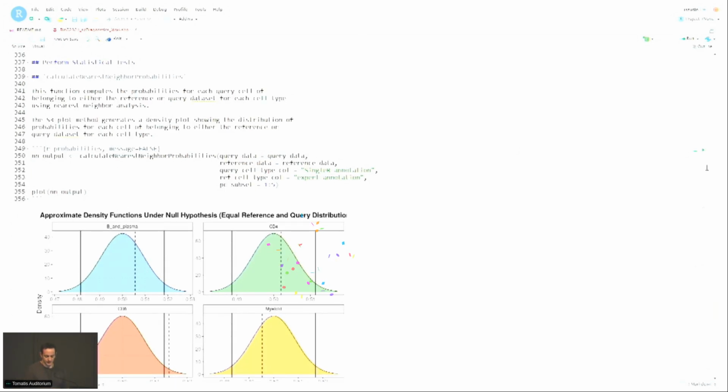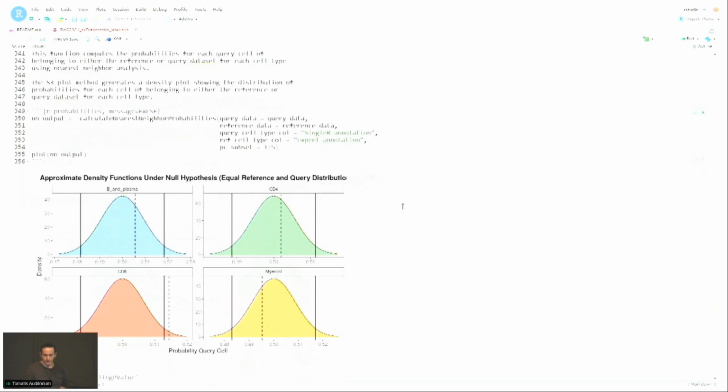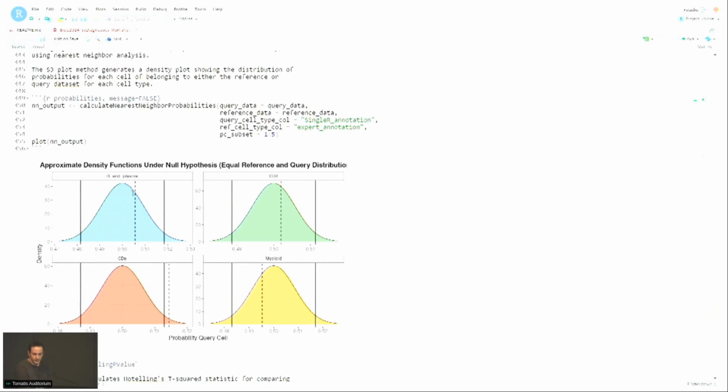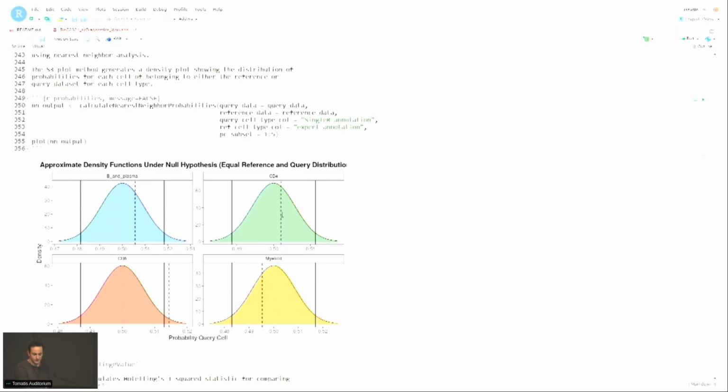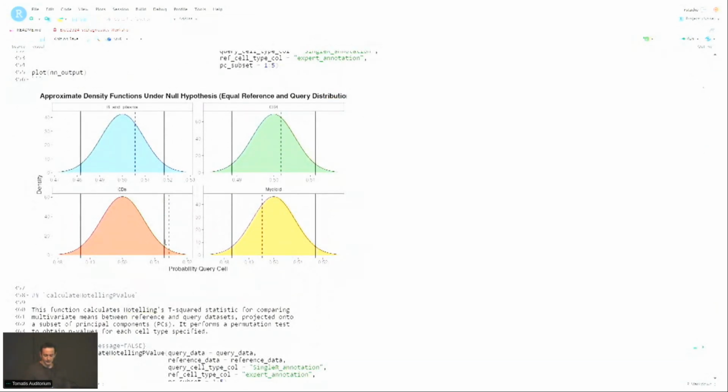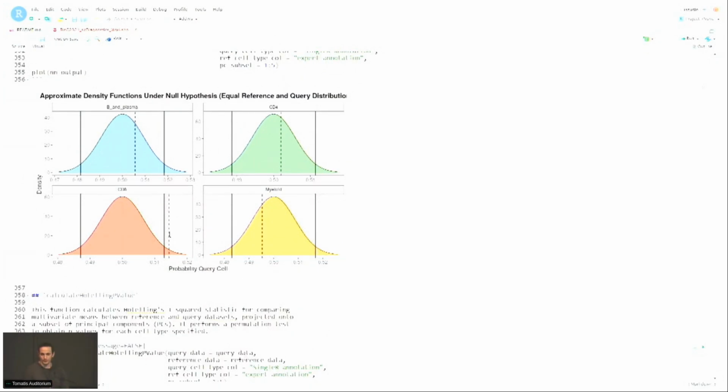Yeah, so this is basically a, if you go through the vignette, there's a lot more details, but this is essentially a statistical test with the boundaries at, depending on the level, the default is 2.5 on the right tail, 2.5 on the left tail. These curves look like they're the same, but they're not, because the Gaussian distribution that results from the null distribution depends on the sample size. So you can notice that the thresholds fall on different values. So, yeah. And then as you can see, for example, for CD8, it obviously falls outside of what you would expect.